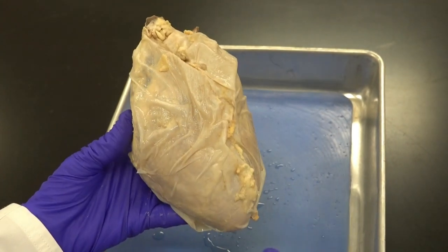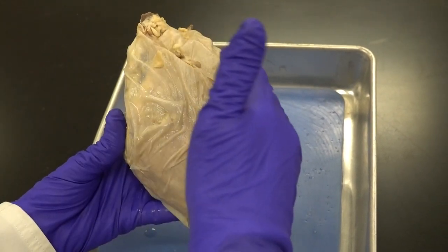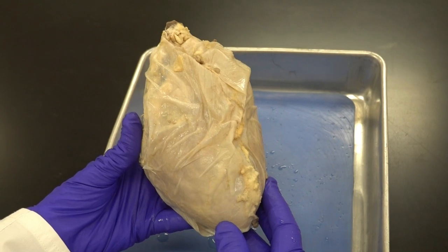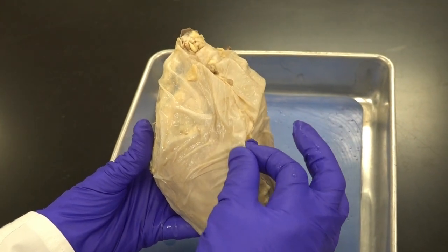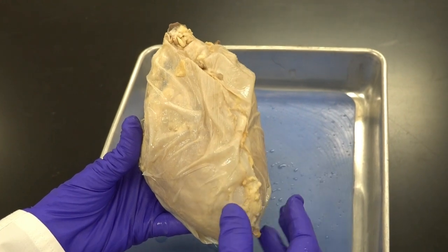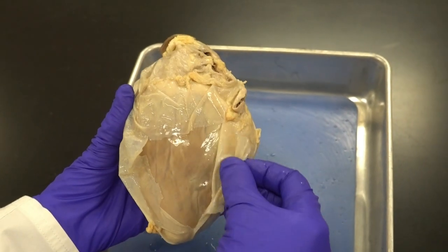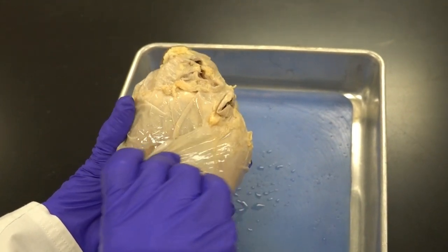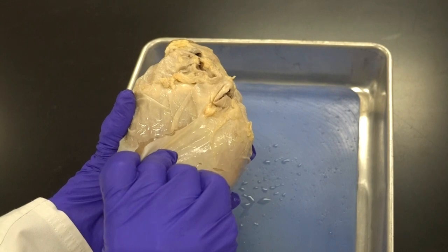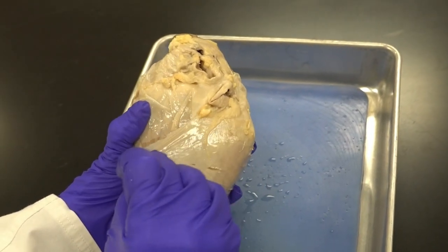Even with the fibrous pericardium I can locate the apex of the heart, and I know the base would be up here. The fibrous pericardium is not the only pericardium around the heart. Here I open the fibrous pericardium a little bit — as you can see it's very strong because it's full of bundles of collagen fibers in all different directions.